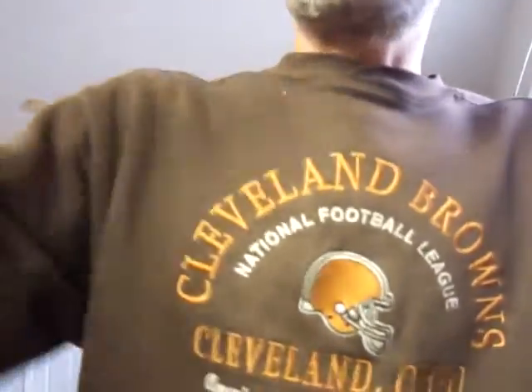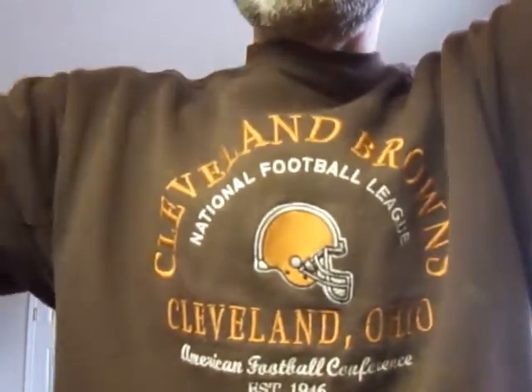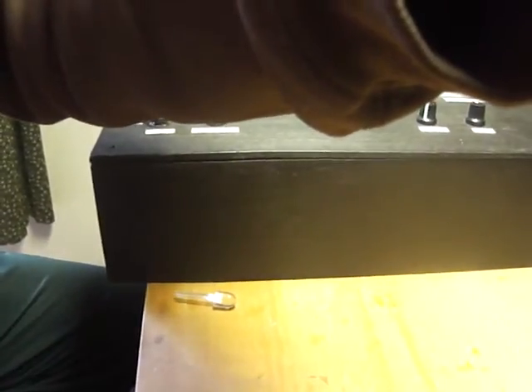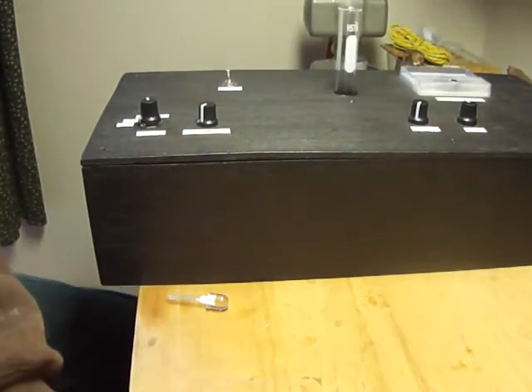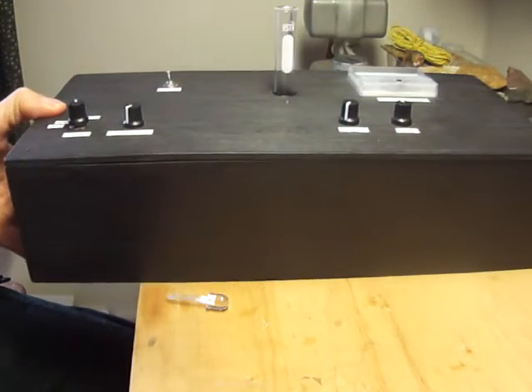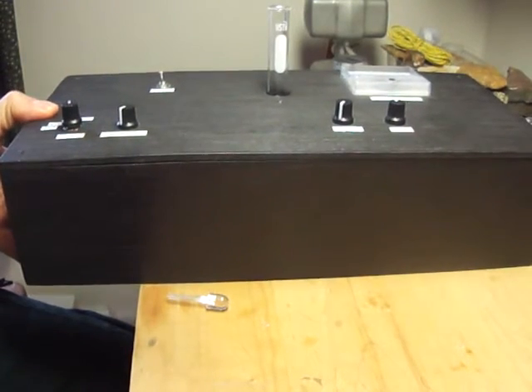This is just the first video of two. This one is going to cover the hardware and the nuts and bolts of the unit, and the second one will be a quick demonstration of it in use. That will probably answer some questions too. So let's take a quick look at it. I'll move the camera here so it'll be a little easier to see.